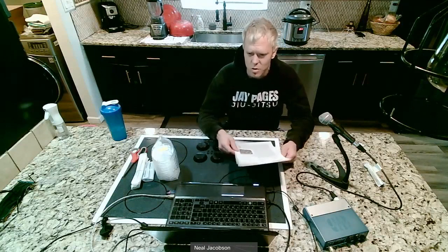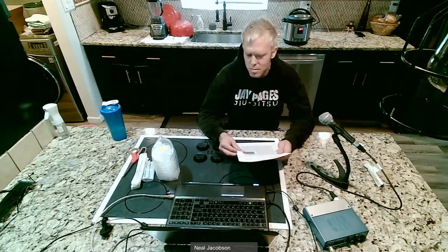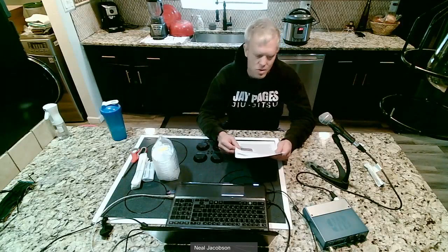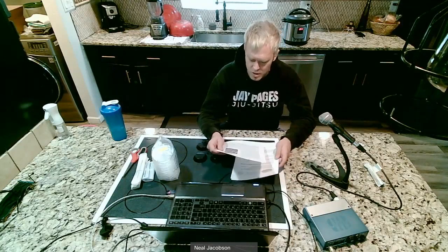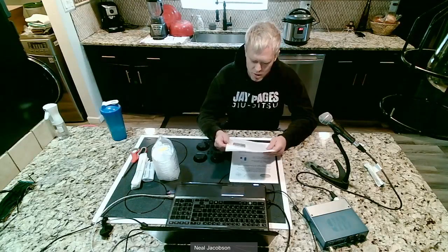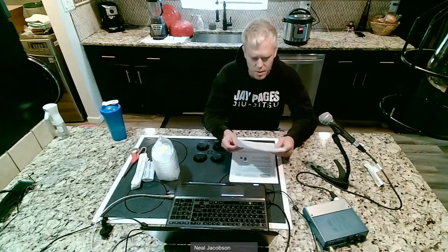We're just using standard nutrients — we'll assume it's like light malt extract and agar in our petri dishes. That's going to be our food for our bacteria.